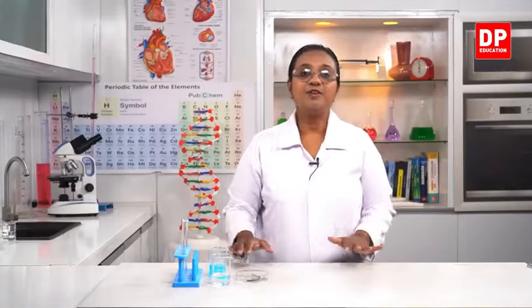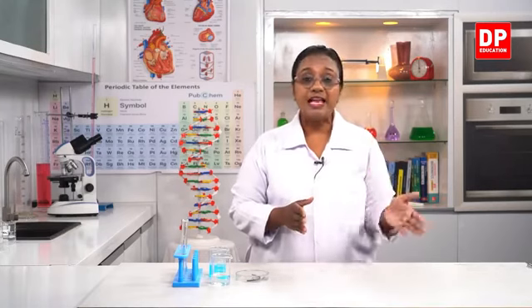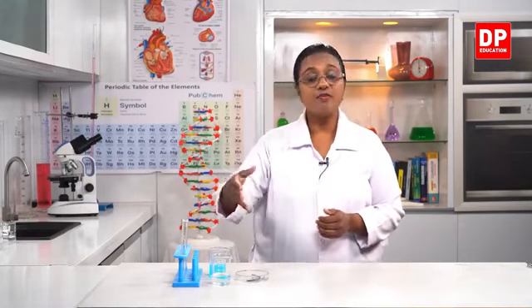Okay students, so now we are going to look at a few single displacement reactions. So you all know in a single displacement reaction there are 2 reactants. One is an element, the other one is a compound. And the element displaces another element from the compound. And finally, in the products also, you get a compound as well as an element. It can be a gas that is evolved or it can be a precipitate. So we will observe a few reactions like that.